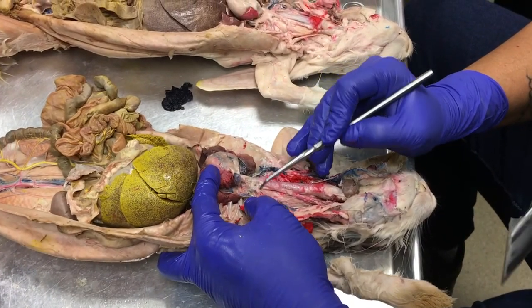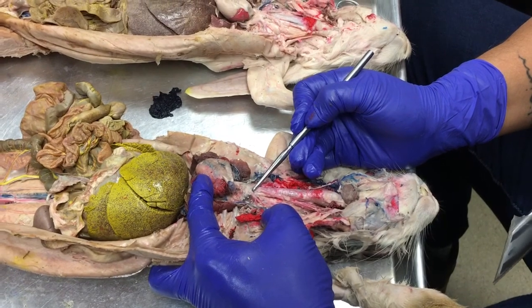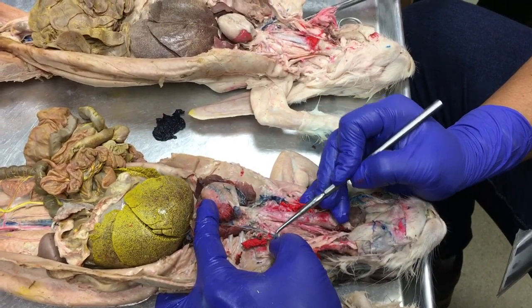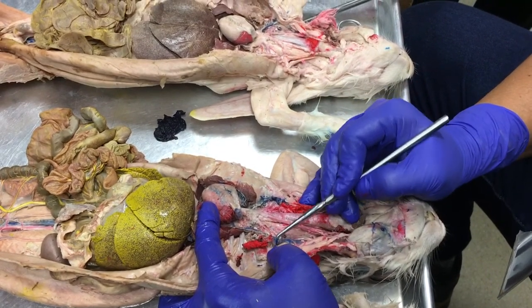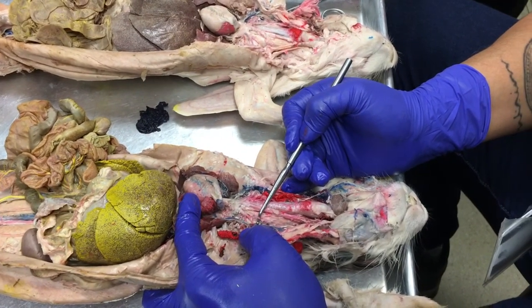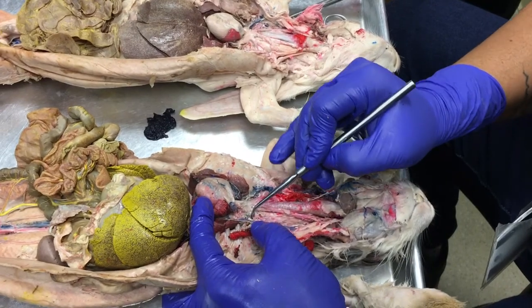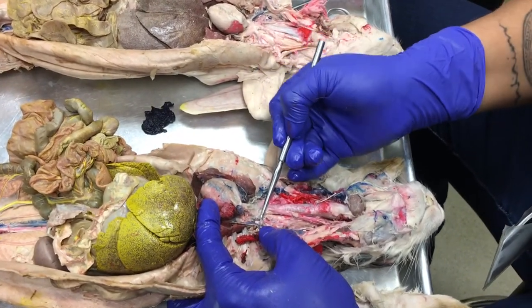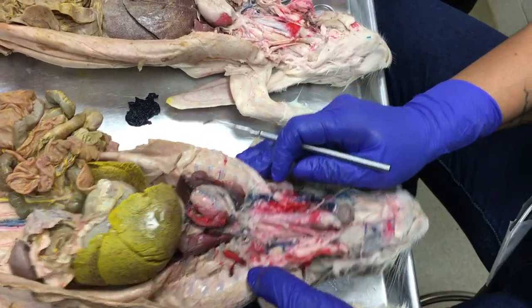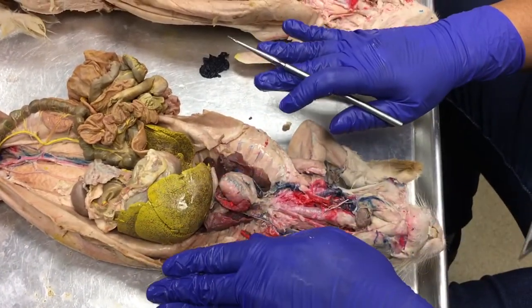Not really. Okay, so here is my left subclavian artery. Okay, I have this lovely branch into the arm, that's the left subclavian artery. I have my costocervical trunk artery. Here's my internal mammary artery, and very much posterior medially is this vertebral artery. Okay, so that's the anterior arteries.